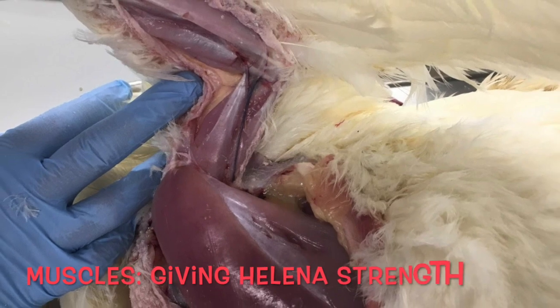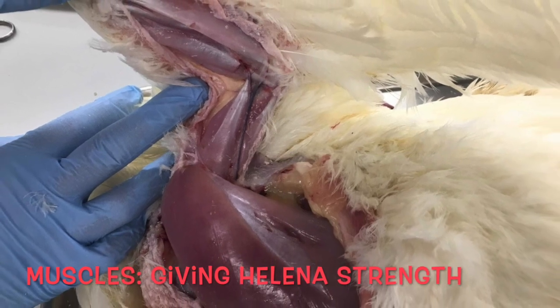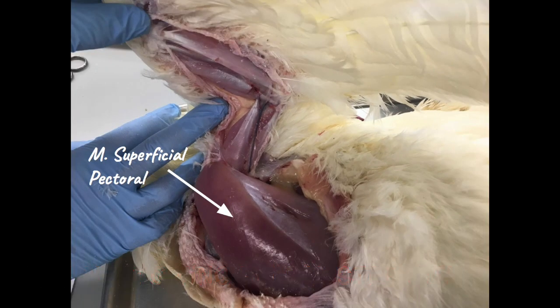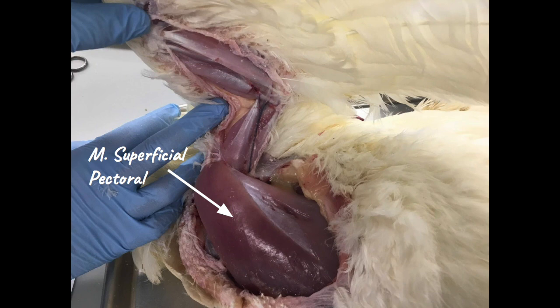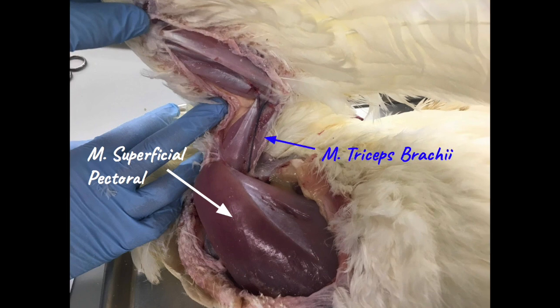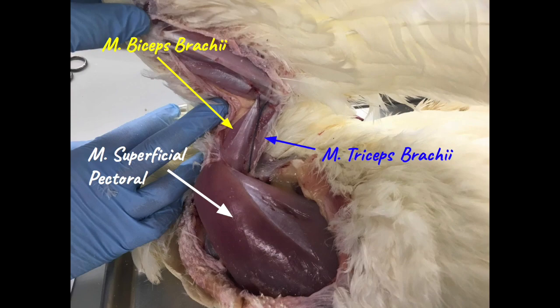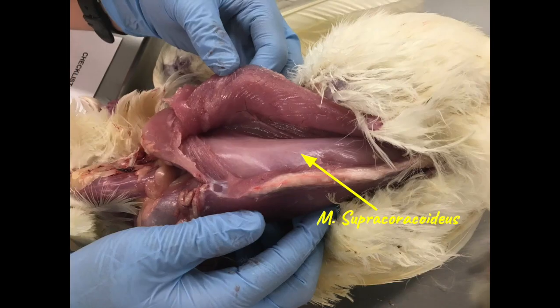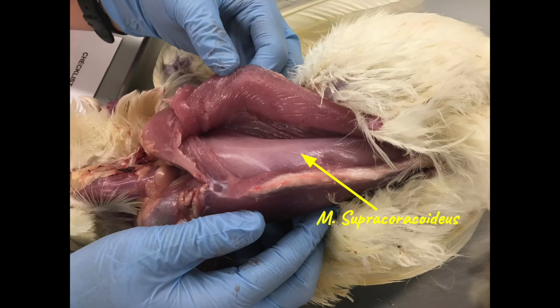Now we shift to the muscles of the wing and breast. The superficial pectoral muscle, or pectoralis major, is the largest muscle in the chicken — it moves the wing downward during flight. Triceps brachii causes extension of the elbow joint and biceps brachii causes flexion. The supracoracoideus is inside the superficial pectoral muscle and lifts the wing upward during flight.